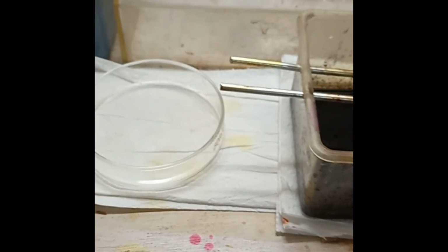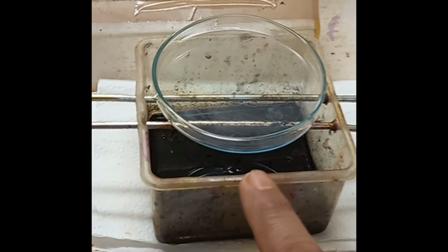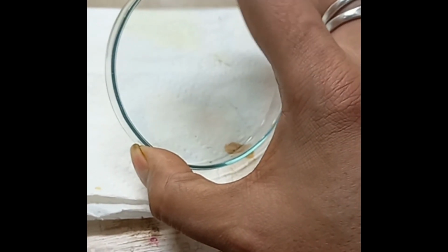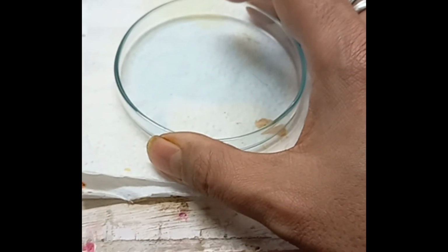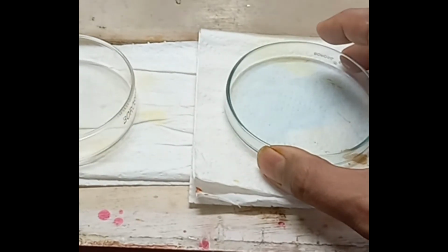Suppose we assume that this box is the stage of the TCM 400 microscope, and you have to place the petri dish over that. The objective is inside this box, and the light is falling from the top. If this glass is very thick, the microscope will face difficulty with focusing, and the image will be blurred. Therefore the thinner the edge of the petri dish, the better. With a thinner edge the focusing will be easier, and the vision and resolution of the image will be very clear.